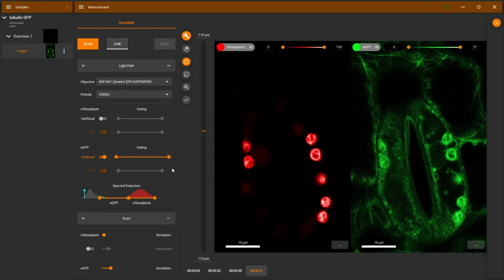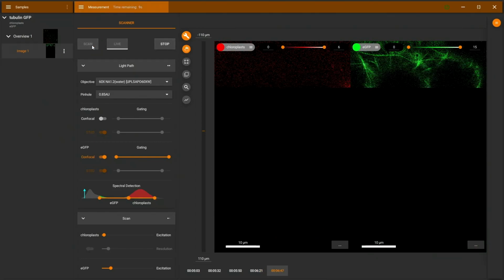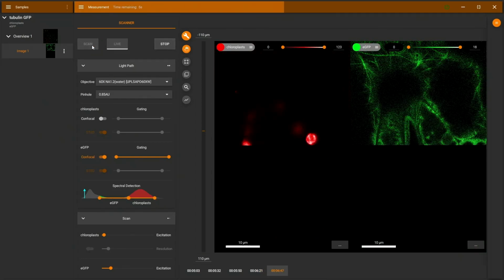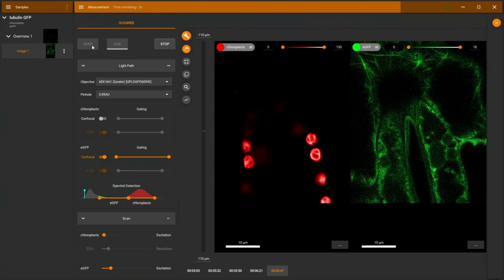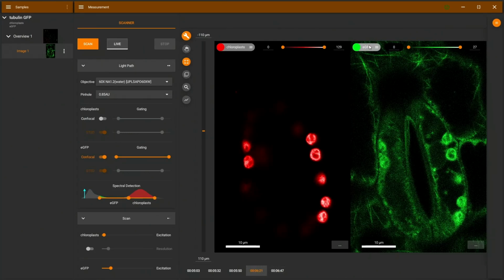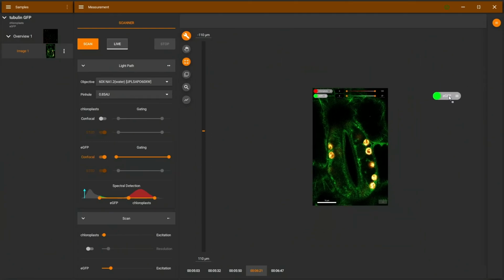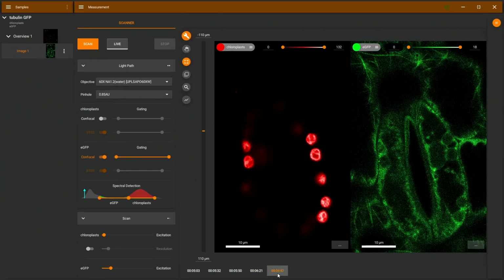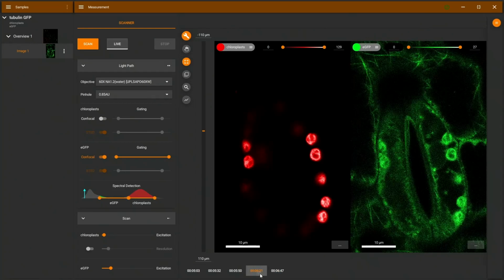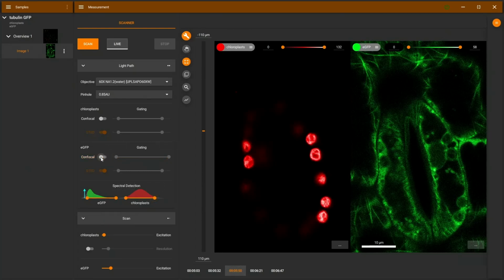And let's see what the effect is of that, just recording it versus with the same settings. And we can see, despite these really bad spectral settings which I chose, the chloroplasts now disappear completely from the image. So switching between the images really makes it clear. And here in the overlay, we can see originally we had lots of crosstalk, and switching between them, you can see time gating really gets rid of the crosstalk, even when we're using bad spectral settings.